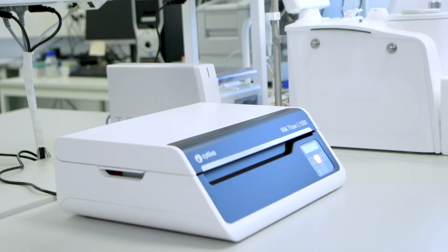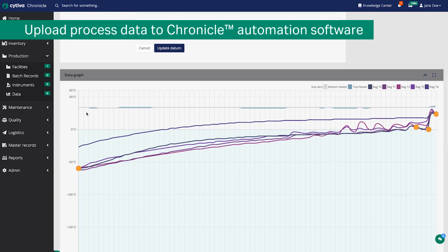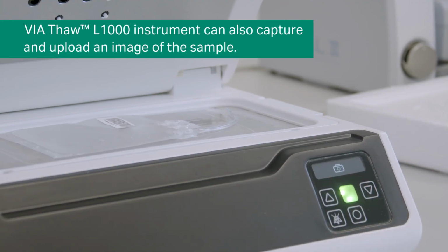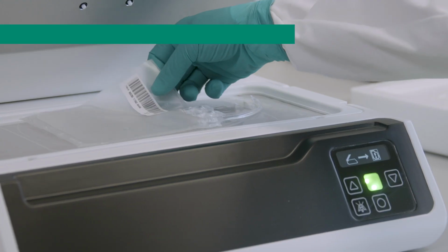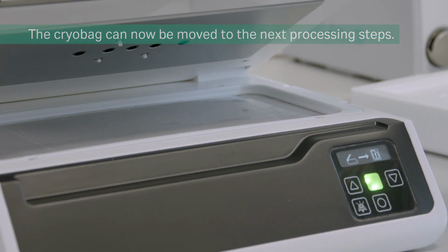Once thawing is complete, press Confirm to stop the process. For traceability, you can upload process data to the Chronicle platform and create an electronic record. Thaw L1000 instruments can also capture and upload an image of the sample. The cryobag can now be removed and moved to the next processing steps.